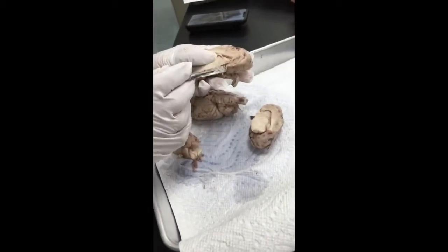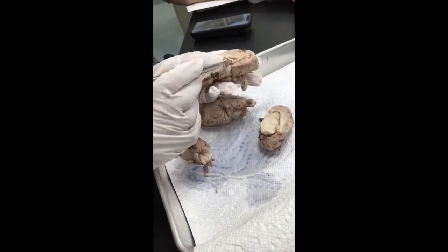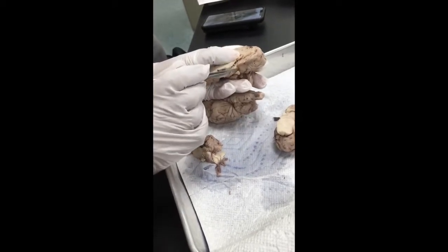The optic chiasma and the nerve for optic would be somewhere over here.